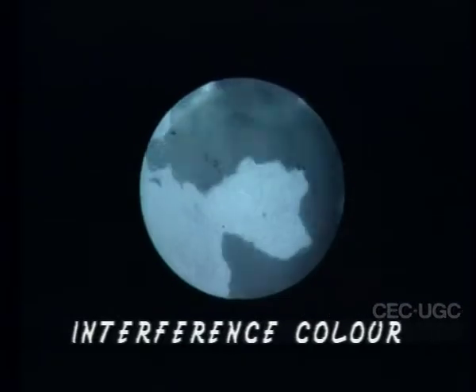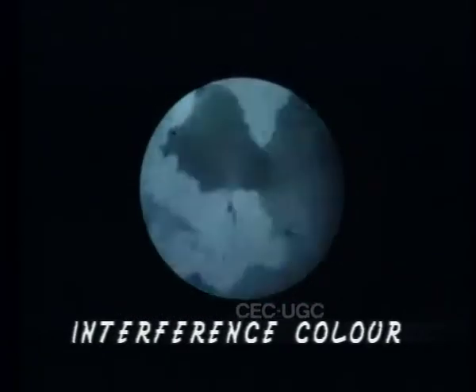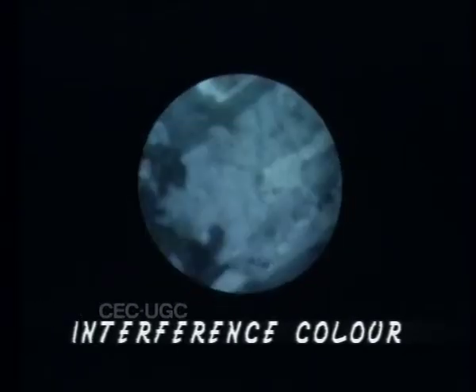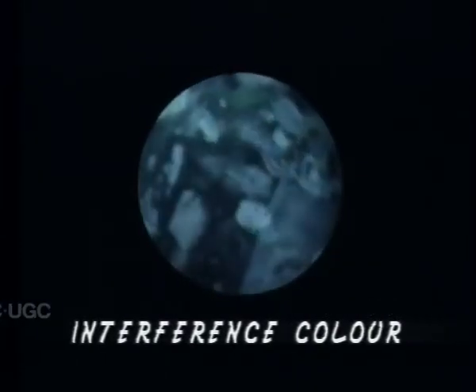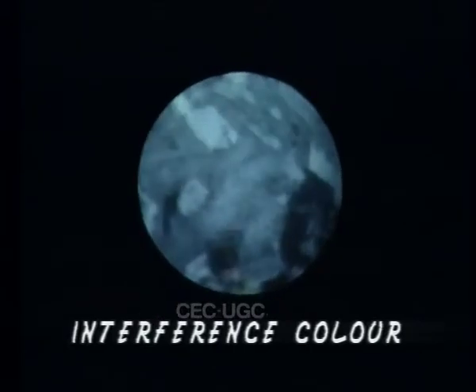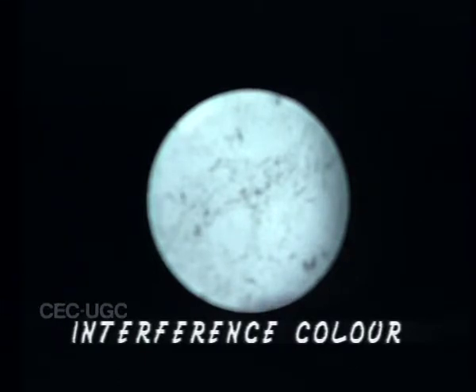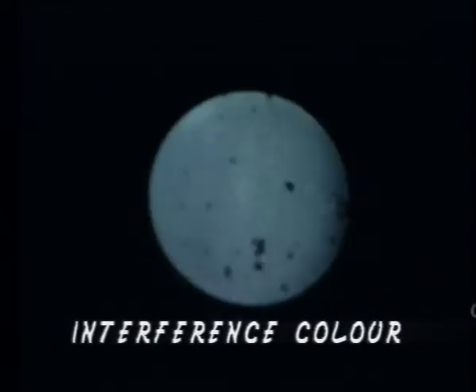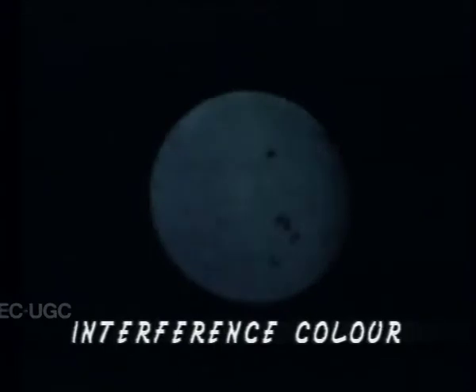Quartz having a birefringence of 0.009 shows pale yellow interference color of first order. All feldspars have smaller birefringence and hence show first order gray interference color. Muscovite, which is colorless in plane polarized light, shows brighter interference colors of third order in crossed position. Calcite, having a large birefringence of 0.172, shows fourth order colors.